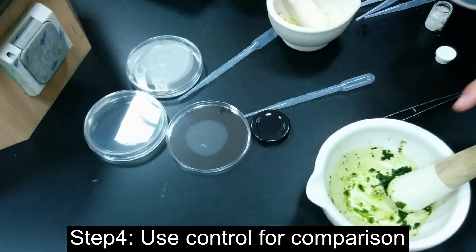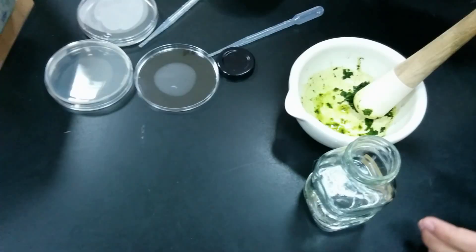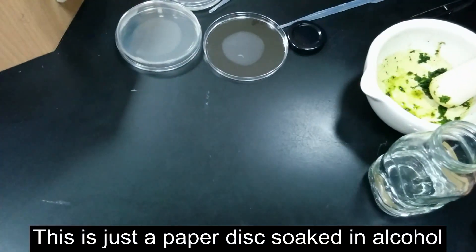Now we're going to do a control so we can compare the effect of mint and garlic.